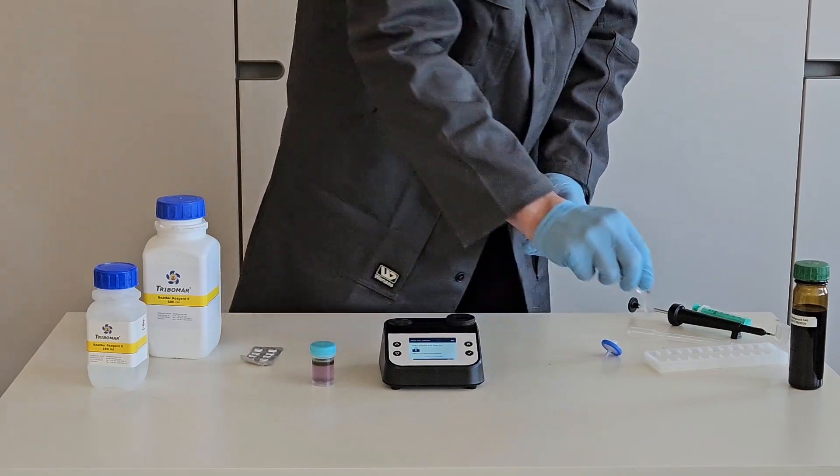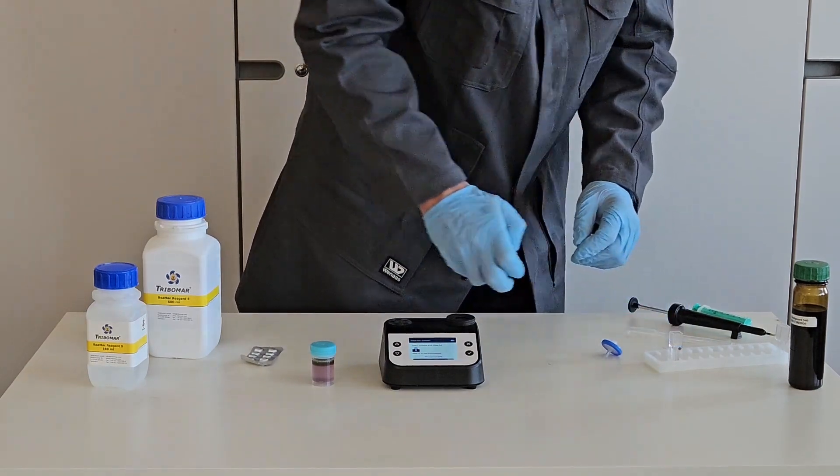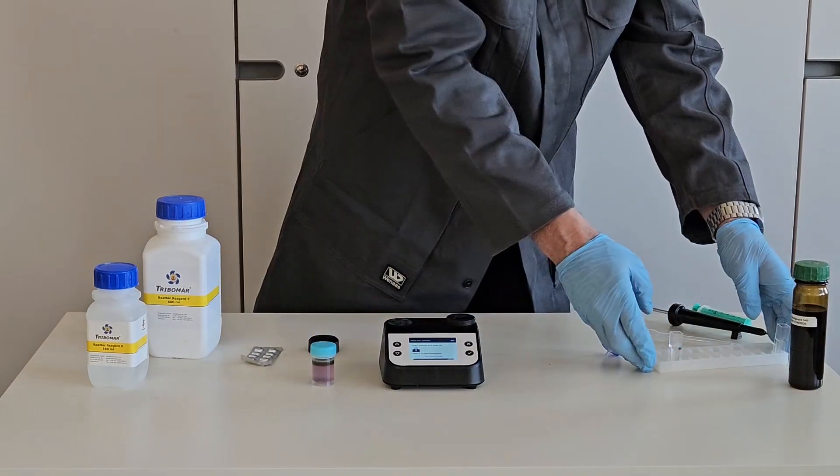At the end of the timer, the device shows next step. Take out the calibration cuvette. Prepare the sample for testing.